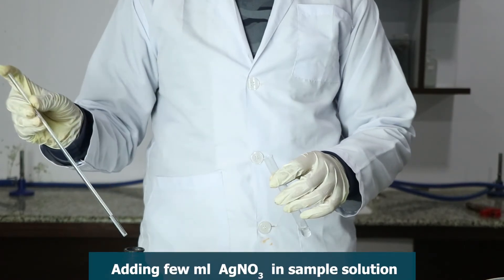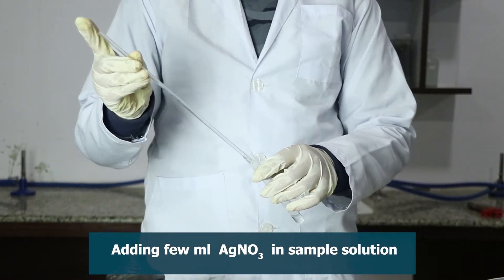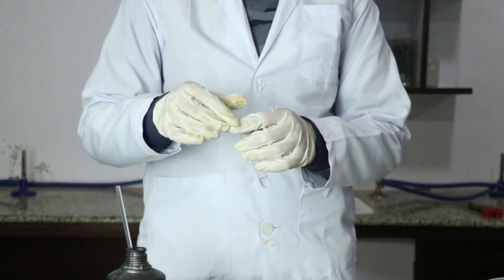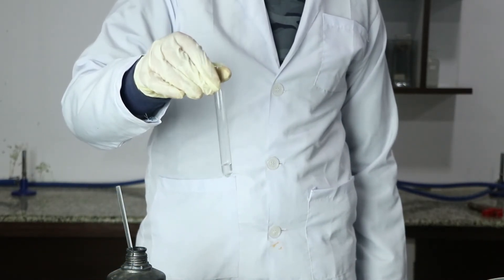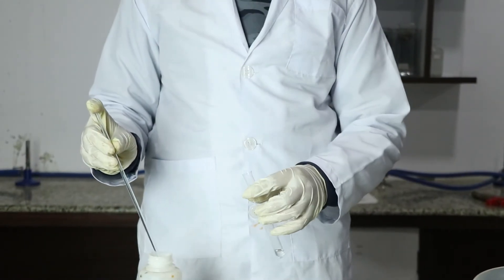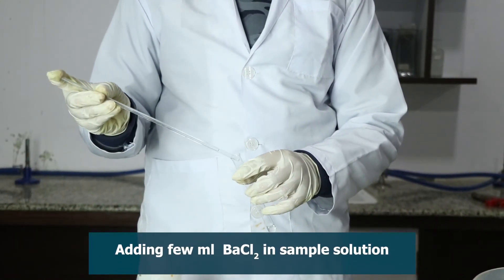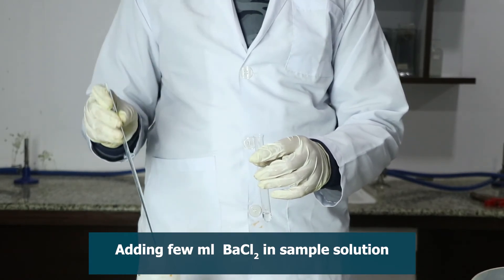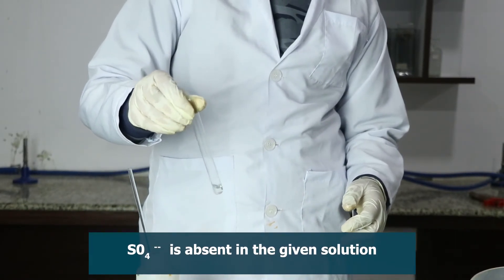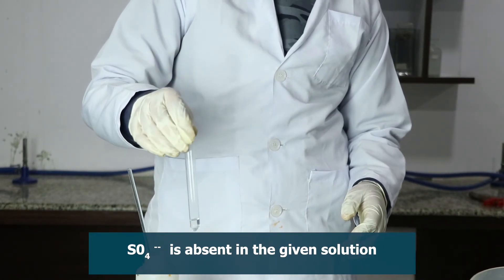Perform silver nitrate test. No precipitate is seen, which proves chloride is absent in the given distillate. Again, perform barium chloride test. No precipitate is seen, which proves that sulphate is absent in the given distillate. Thus, the obtained distillate is pure.